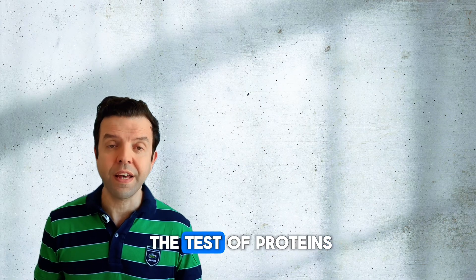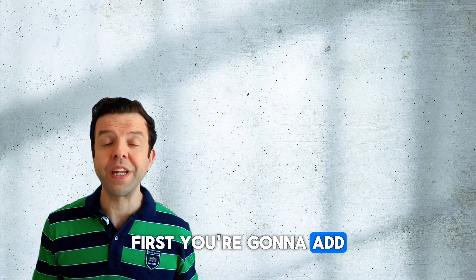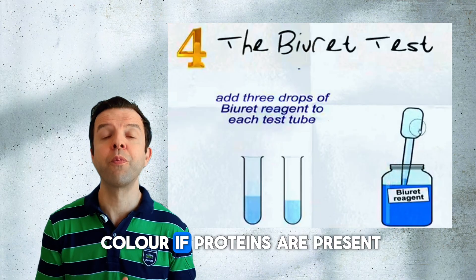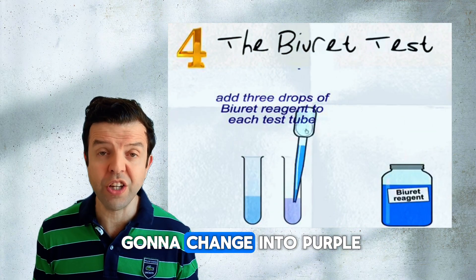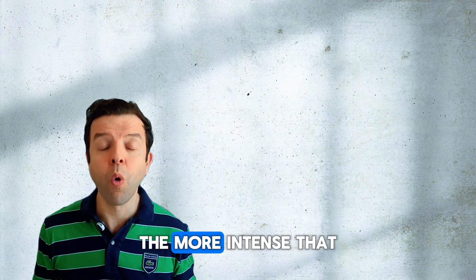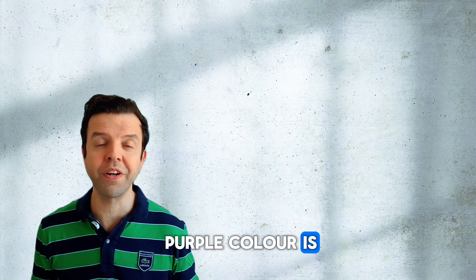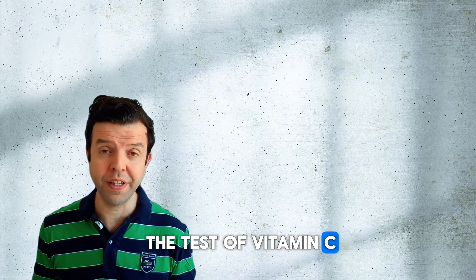Test number four is the test of proteins. First, you're going to add the biuret solution, which has a blue color. If proteins are present, then the color is going to change into purple or lilac. The higher the concentration of proteins, the more intense that purple color is.